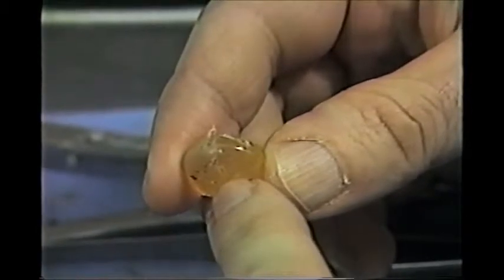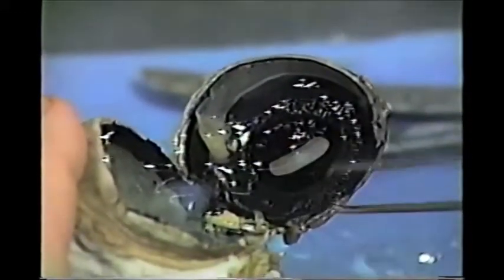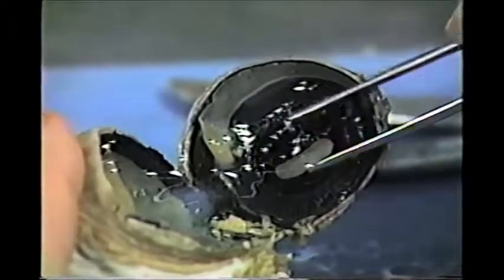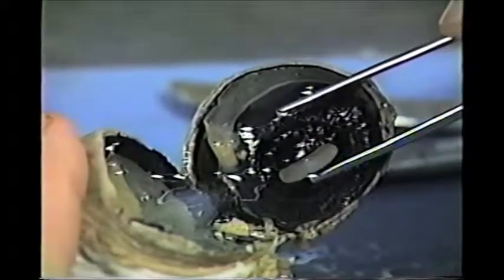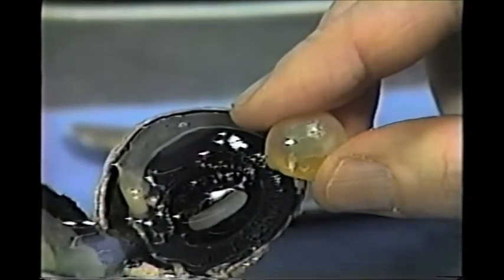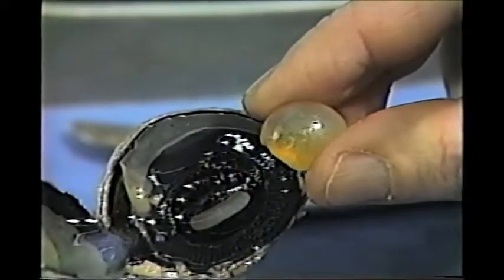The shape of the lens is controlled by the ciliary body, which has muscles that control the shape of the lens in order to form a clear image in the back part of the eye. When you look at something far away, the lens is elongated — it's stretched by the ciliary body. When you look at something close up, the ciliary body relaxes and the lens balls up, becomes more rounded, so you can read close work. Unfortunately, as we age, the lens becomes less and less elastic, and therefore we have poor close vision — we become more far-sighted and can't see close up, so we need reading glasses.